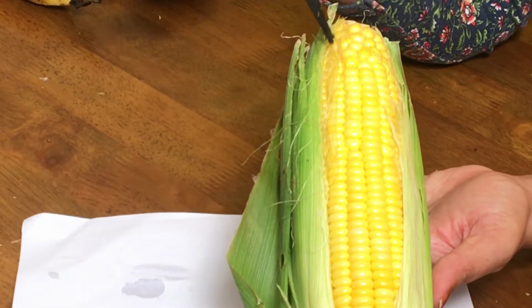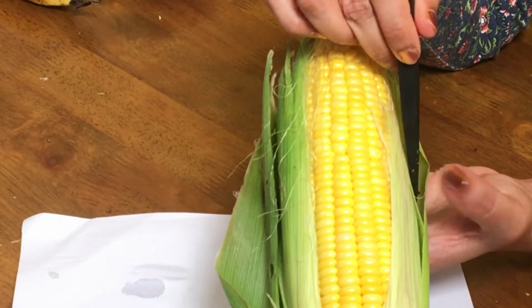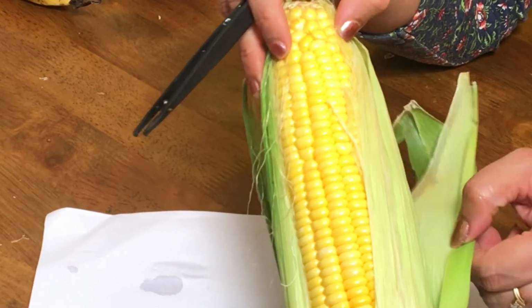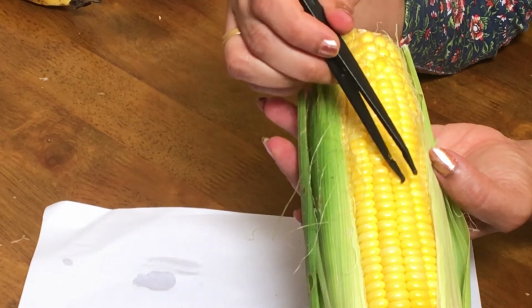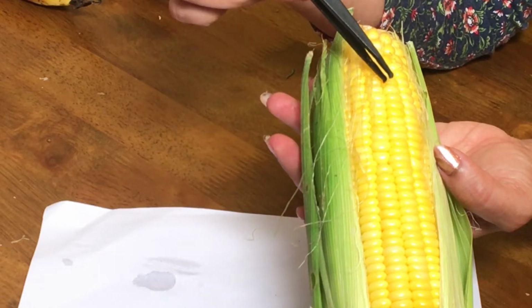What is this? This is a corn cob or corn ear. What are these green leafy like structures which you can see? Commonly called as a husk of corn, but this is the bract of the inflorescence. Now what are these yellow color tiny structures? These are the fruits, and each of them are formed from separate carpels.